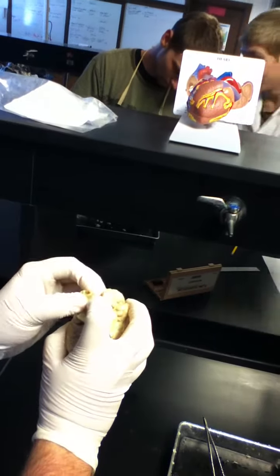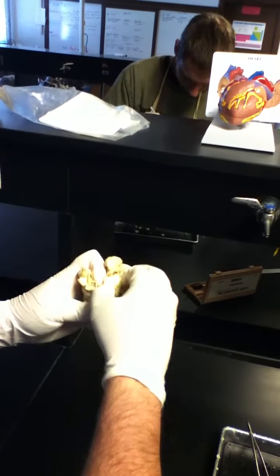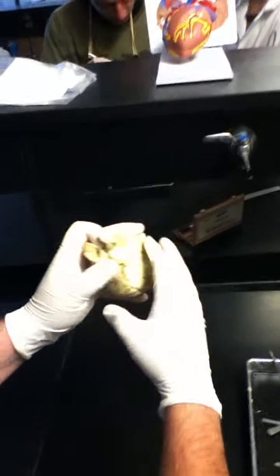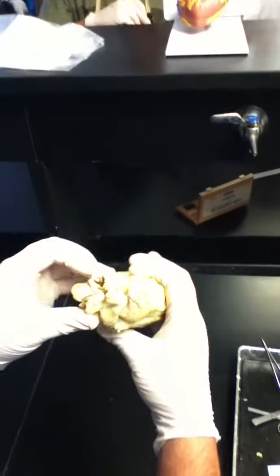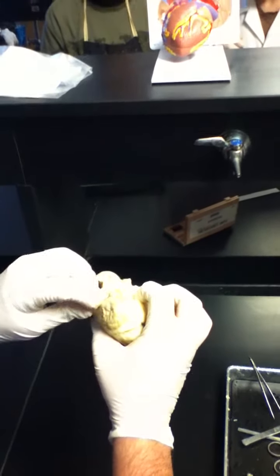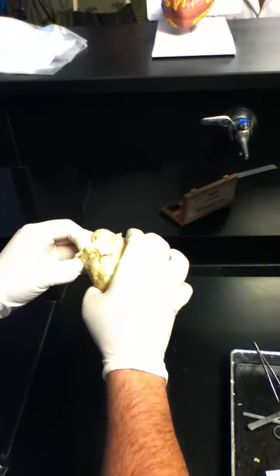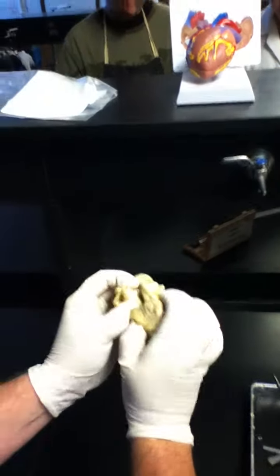There's veins. Veins, like the superior vena cava, are not thick. What about that very top hole that's near the aorta - is that still part of the aorta? Let's see - no. I see it. So we've got the aorta. You said that was the superior vena cava? That's one right here. That's pretty cool. That's a valve. The main pulmonary is right there. And then that fourth one, that smaller one - looks like the thing that comes up from the aorta. This may be a pulmonary vein. The colors up there are very misleading.